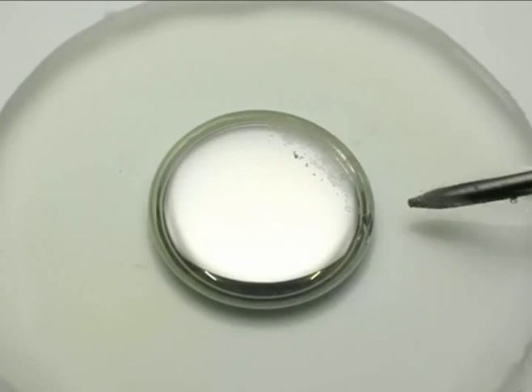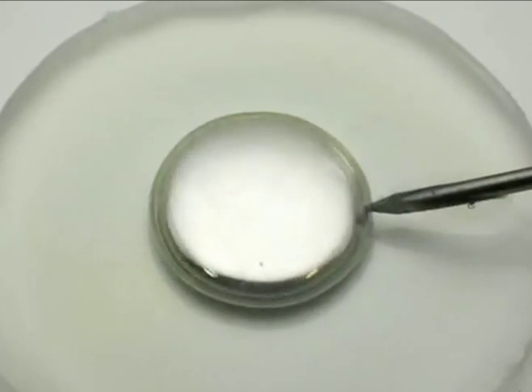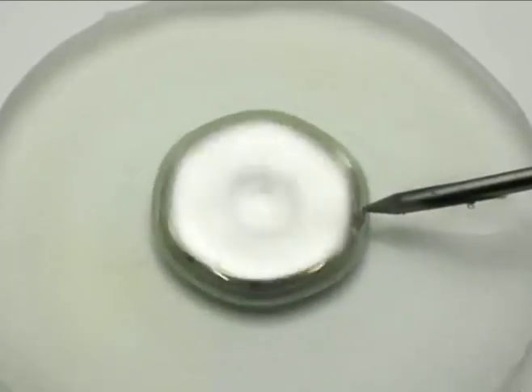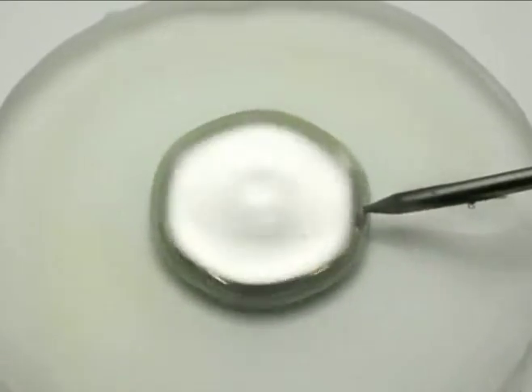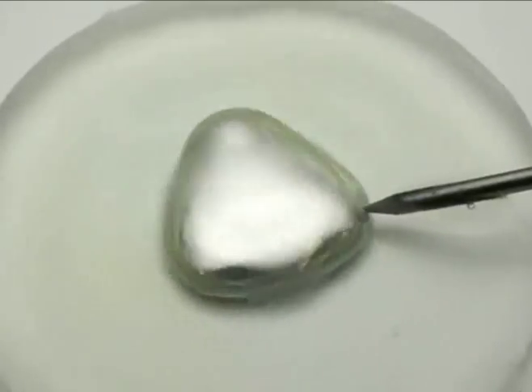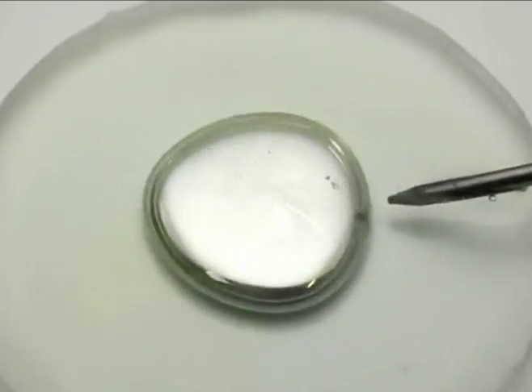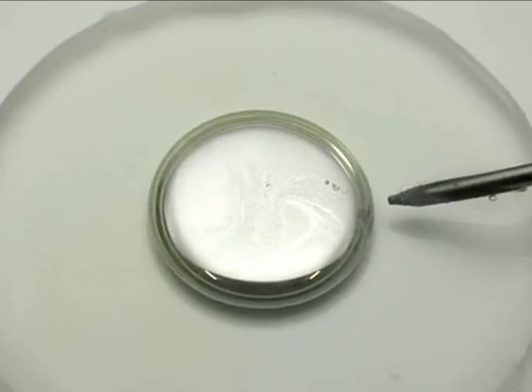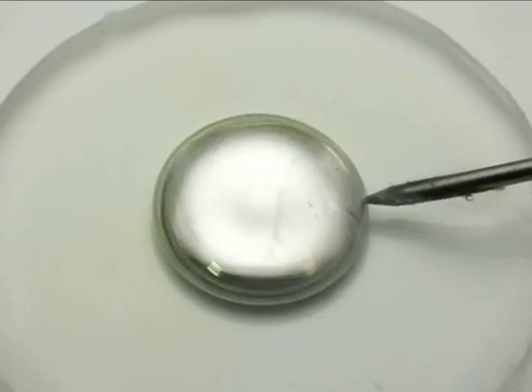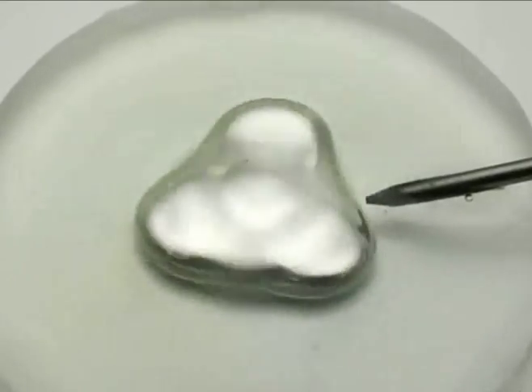This is a drop of mercury immersed in an acidic solution. At the right is an iron nail. When the nail touches the mercury, the mercury contracts. When the mercury contracts, it no longer touches the nail. The mercury then expands and touches the nail again, which causes it to contract.